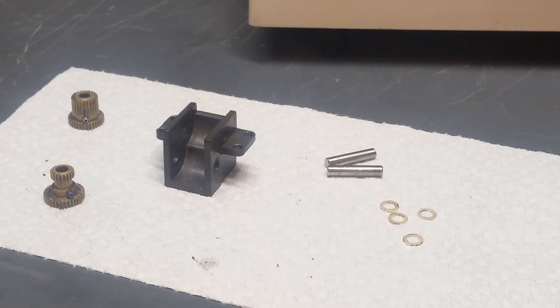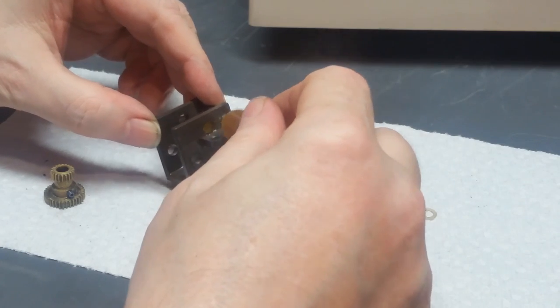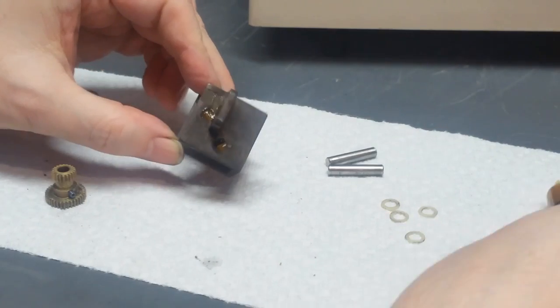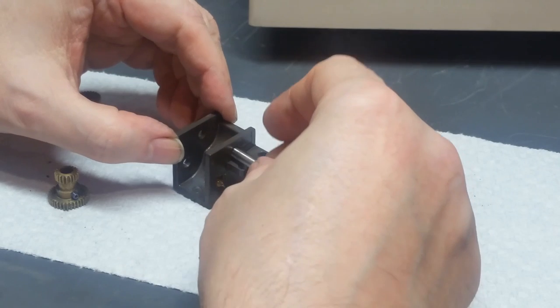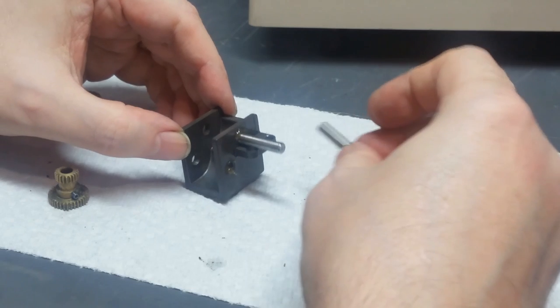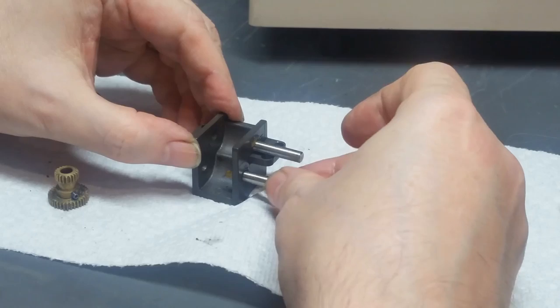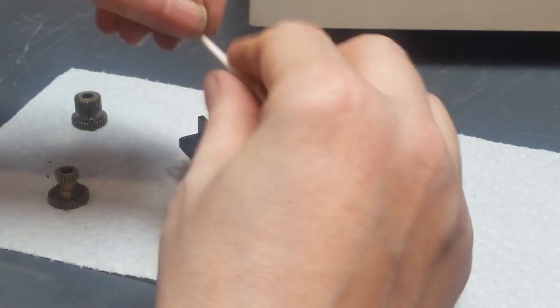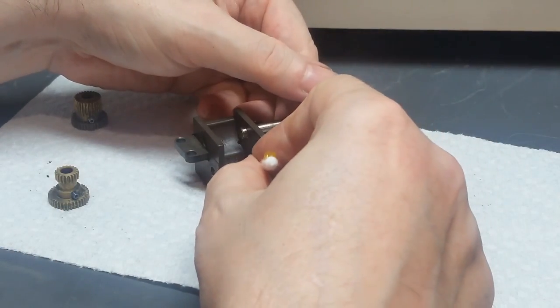Okay, so with everything clean, I'm going to proceed with reassembly. Get this gearbox put back in. To start out, I'm just going to put a little bit of grease into both of these holes. And I'm not going to worry about what squeezes out yet at this point. Get it all distributed nice. I'm going to take these two shafts and put them in these holes just barely started, so that they just stick through on the end. And I'm going to go in there and take off the excess grease for now.